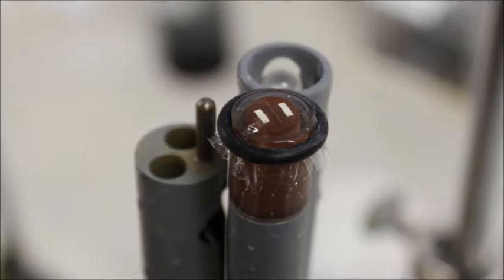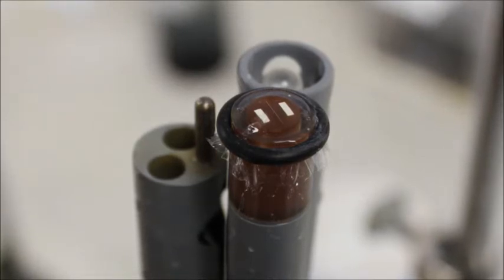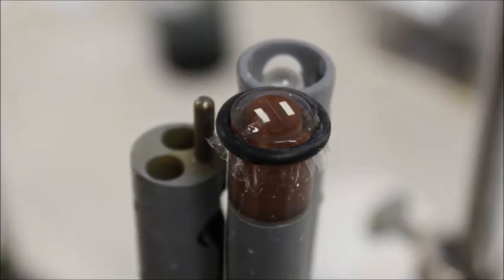Usually, taking a few moments to replace the DO solution and membrane will resolve any problems related to DO readings.